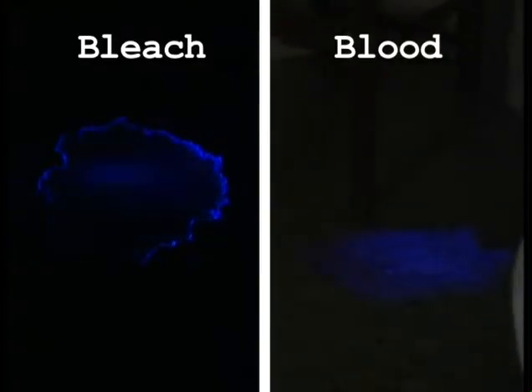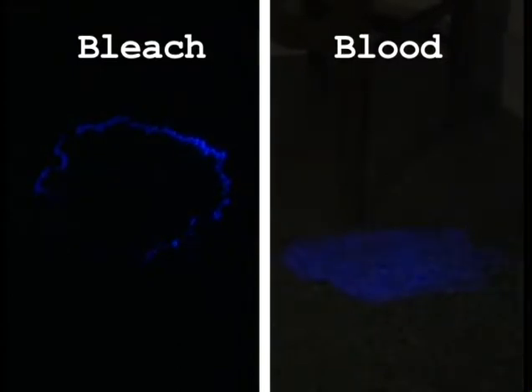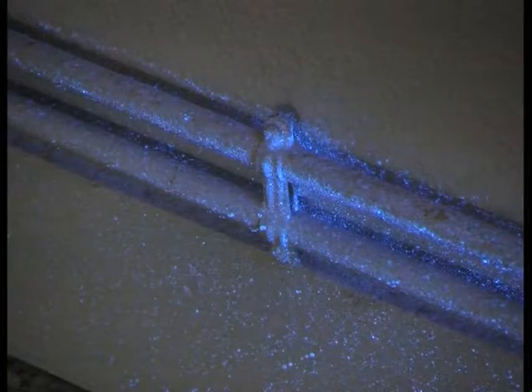Whereas on blood, the reaction lasts at least 30 seconds or even up to 2 minutes. When we see this false positive with bleach, we have a reaction that really only lasts for an instant. The technician who sees this type of reaction should not take a sample because he already knows that it is a false positive, thereby saving time and not submitting a useless DNA sample to the laboratory.